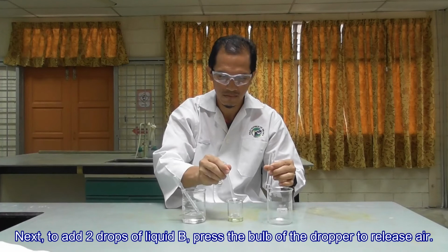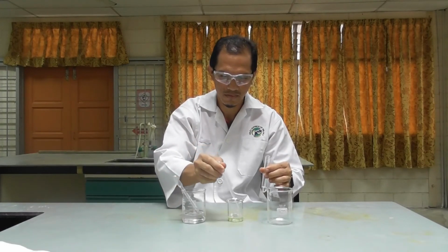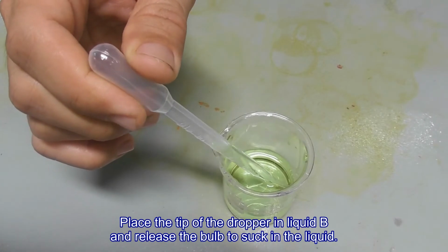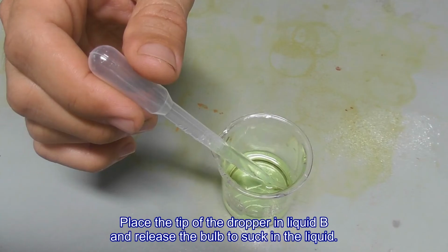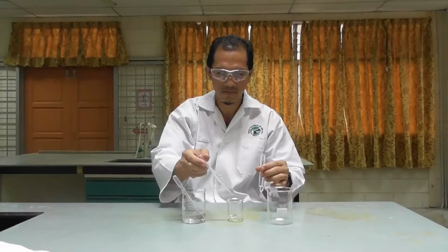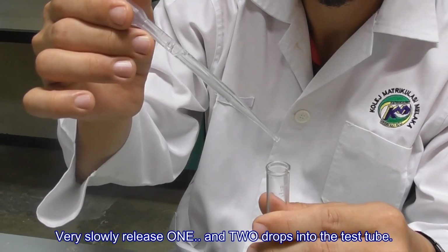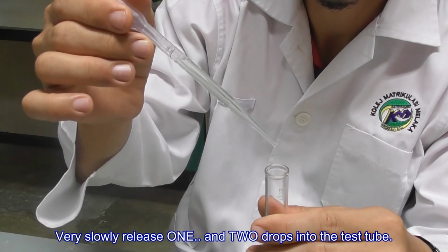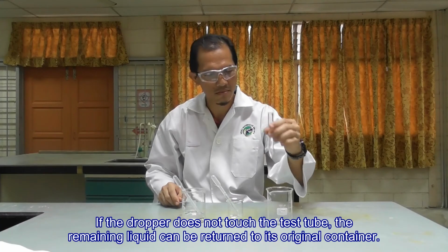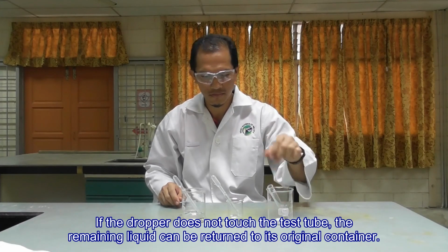Next, to add 2 drops of liquid B, press the bulb of the dropper to release air. Place the tip of the dropper in liquid B and release the bulb to suck in the liquid. Very slowly release 1 and 2 drops into the test tube. If the dropper does not touch the test tube, the remaining liquid can be returned to its original container.